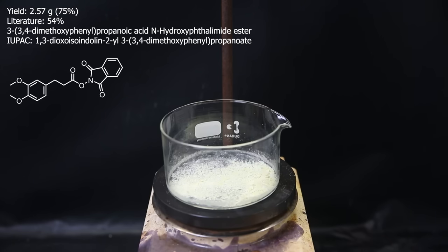Either way, it isn't a huge problem if this product isn't completely pure since the next reaction will work regardless. Also, the purification doesn't have to be done. With the modification to the reaction solvent, the reaction mixture can instantly be forwarded to the electrochemical reaction without isolating the product.